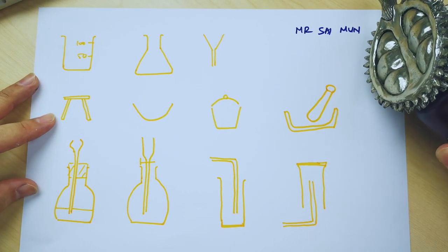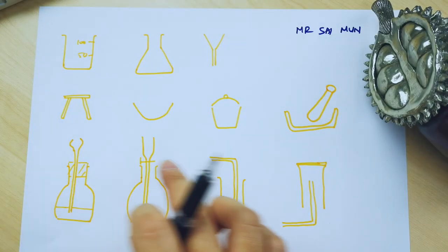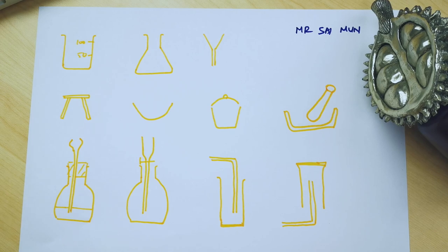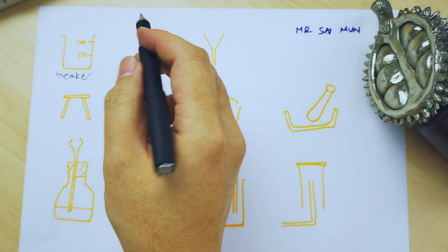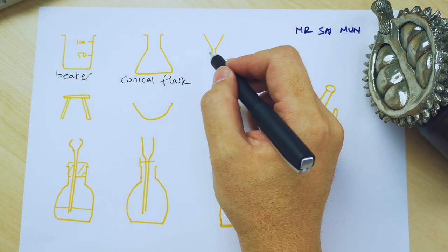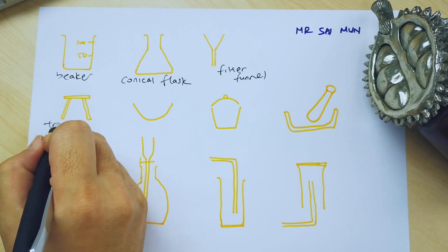These are the common apparatus asked in Paper 6 — some are common and some are a bit different. When you see a cylindrical shape with a scale at the side, that is a beaker. A triangular flask shape is a conical flask. If you see a funnel shape, that is a filter funnel — they do accept just 'funnel' as an answer.